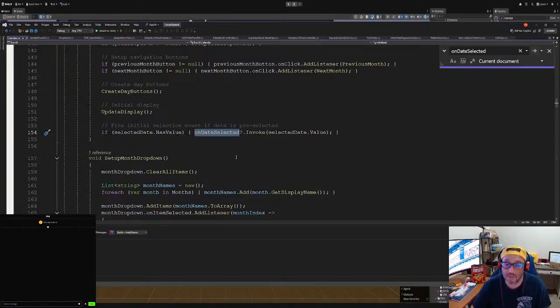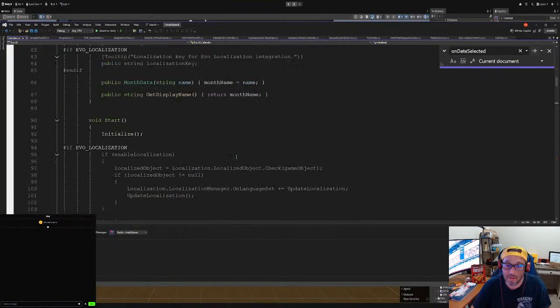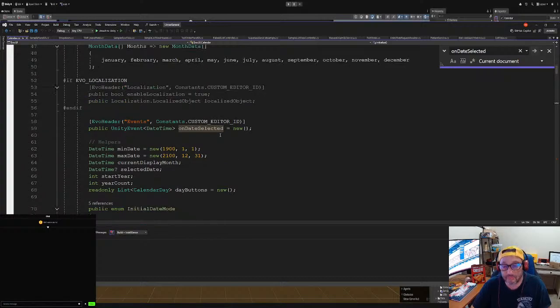So I have a choice here. I could either return a, or do, okay. So you know what I do? I don't want to mess with this, it's a plugin.